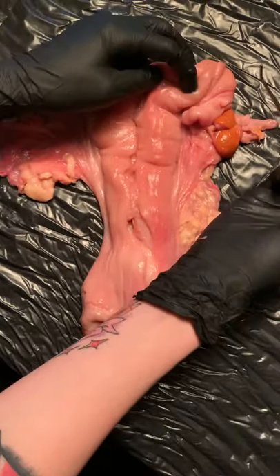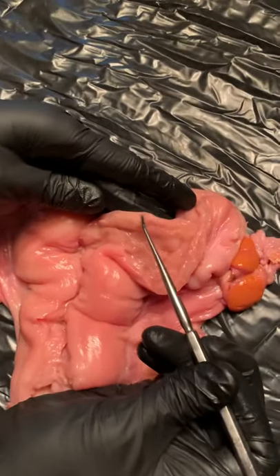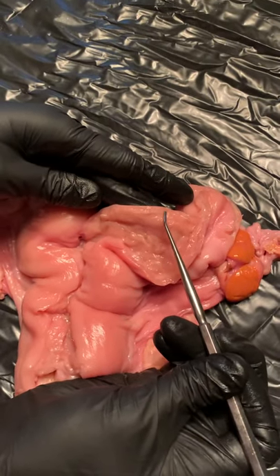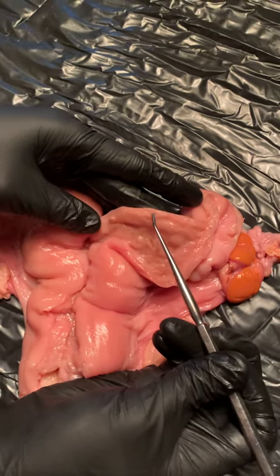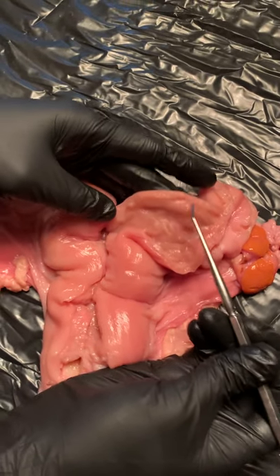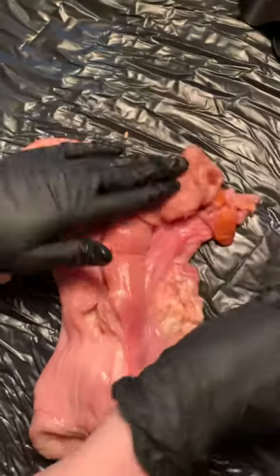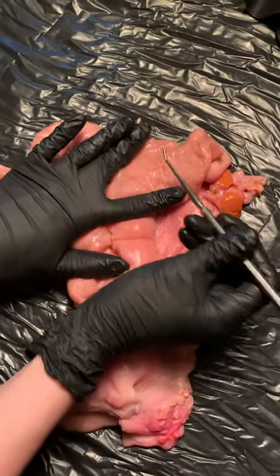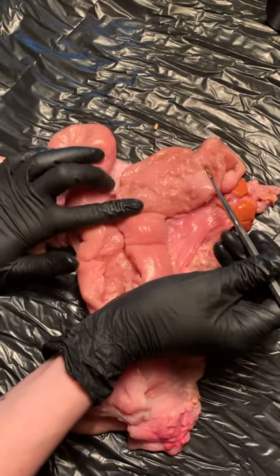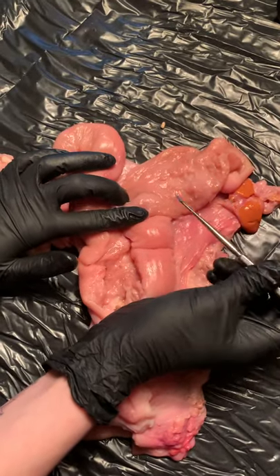The myometrium is this outer layer made of muscle fibers, responsible for contractions, which either expel the fetus or carry semen up through the reproductive tract. This jelly-like inside is the innermost layer of the uterus called the endometrium, which consists of the mucosa and submucosa.